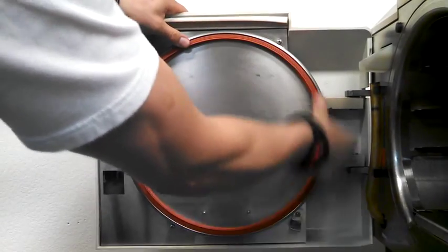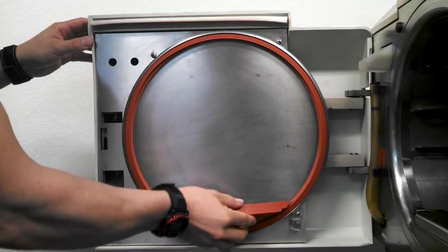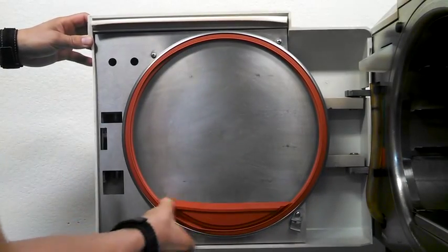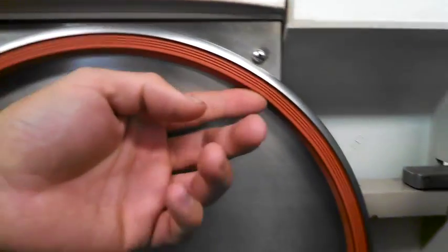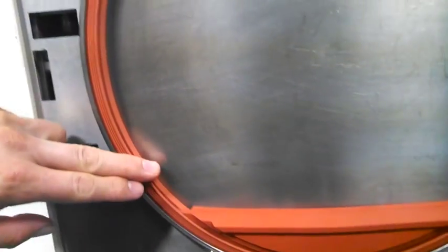Worn out gaskets can cause errors to come up having to do with pressure and temperature, and they can also lead to additional repairs such as replacement of sensors and other parts. Here's an example of what a new door gasket looks like. And we should mention that if gaskets are not properly mounted, leaks and errors could continue.